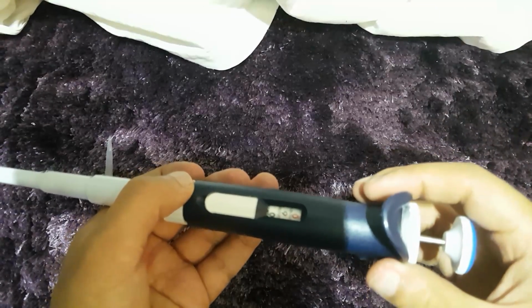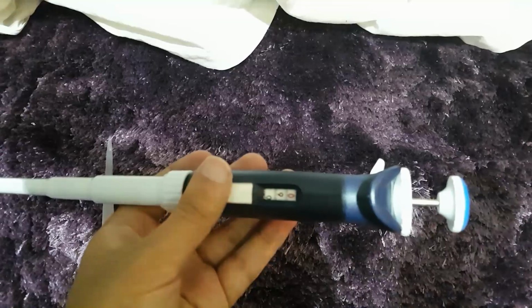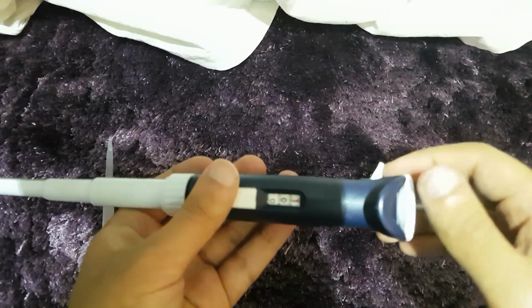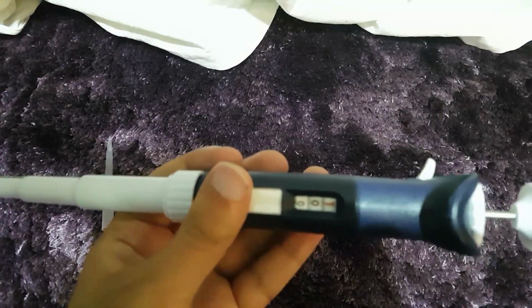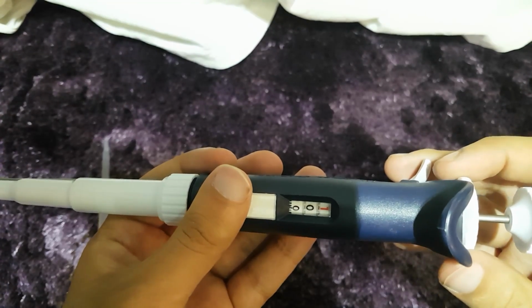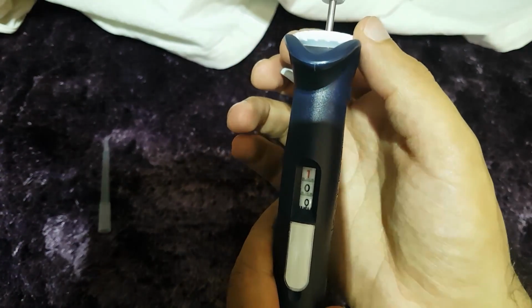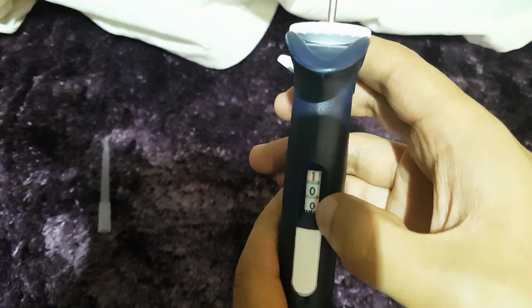Now, we're going to learn how to adjust the volume on the pipette. As you can see here, once you get in focus, you can literally pull up the adjustment knob and turn it. For example, you can see here it's set on 1 milliliter. The big red one, which is the top unit, means 1000. Going down, the next one below that is 100, the one below that is 10, and then the little dials at the bottom are in increments of 2.